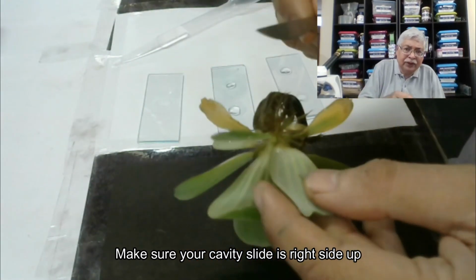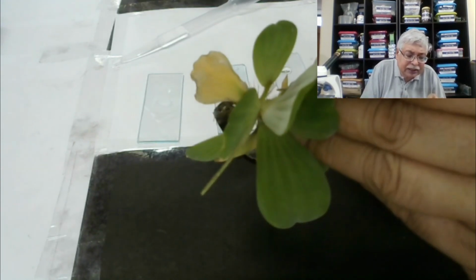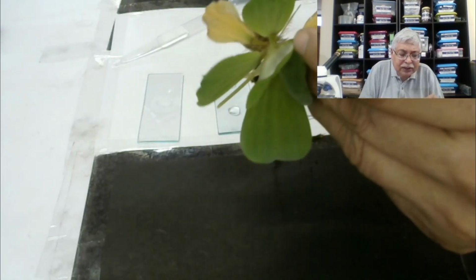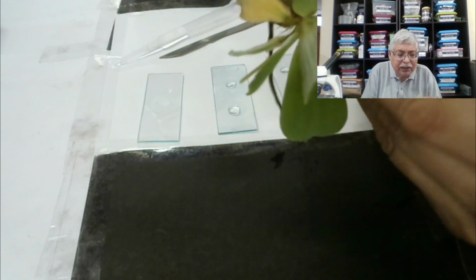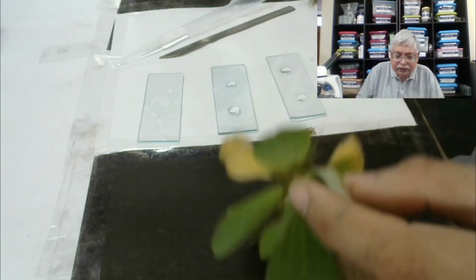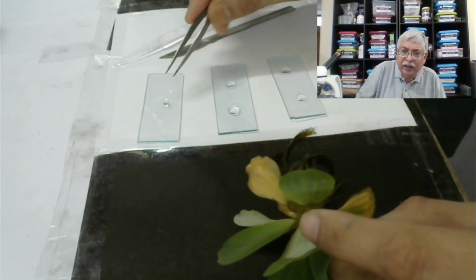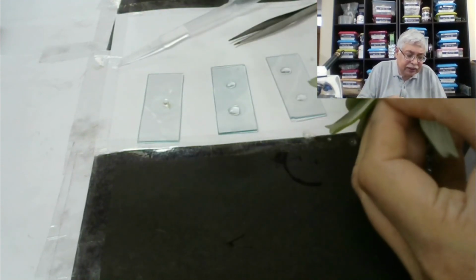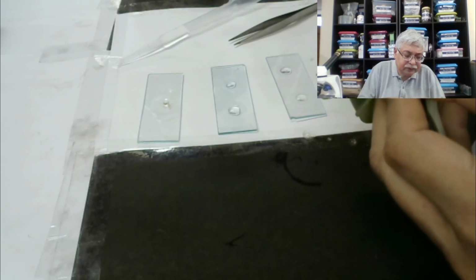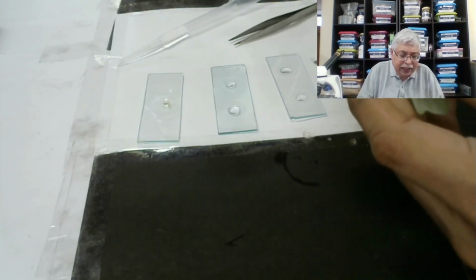Now, with the help of the scalpel, when we scrape the egg case, well, I need to use forceps because it's entangled. I can keep it here. There is one more egg case, so we will do it in another slide. I am taking multiple because I don't know in which egg they are mature.